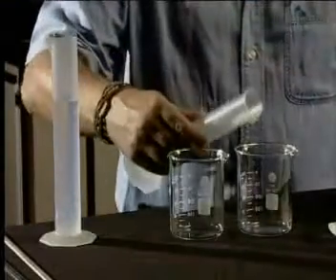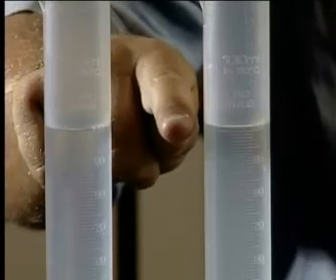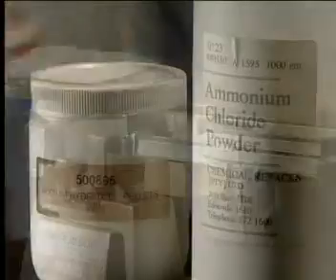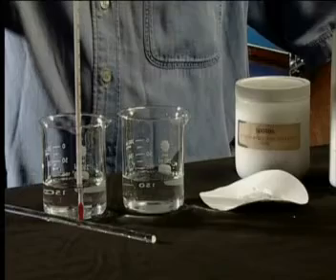In this lesson we will look at an experiment that will show you that not all solutes dissolve in exactly the same way. For this investigation we will need two beakers, each containing 100 milliliters of water — water is the solvent. Notice that the volume of solvent used in both beakers is the same; this ensures that the test is fair. You will also need the same mass of two different solutes: sodium hydroxide and ammonium chloride. A thermometer is used to detect any temperature change when the solute dissolves. The independent variable is the type of solute used.